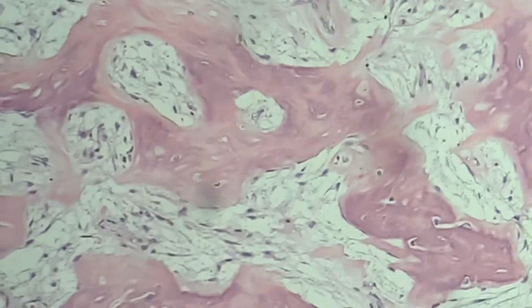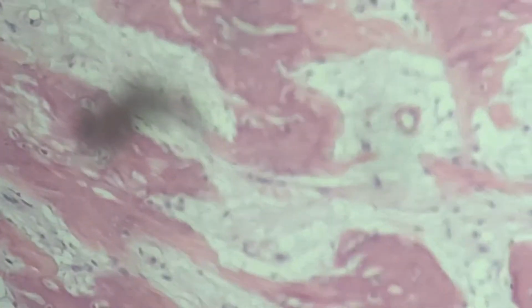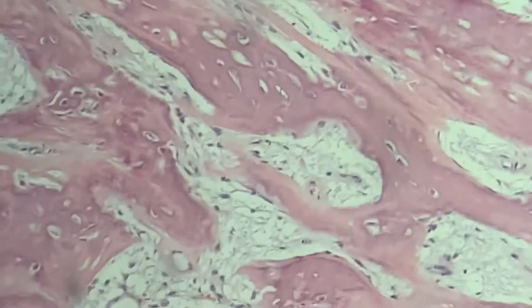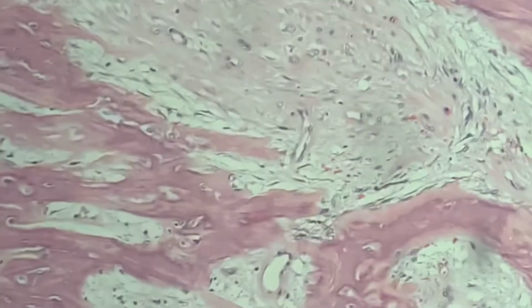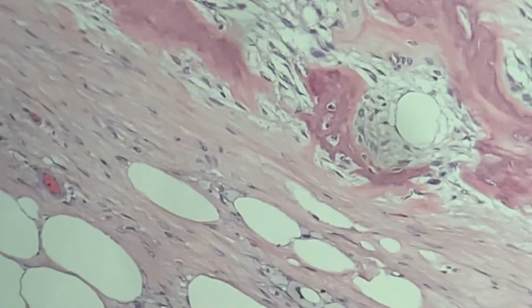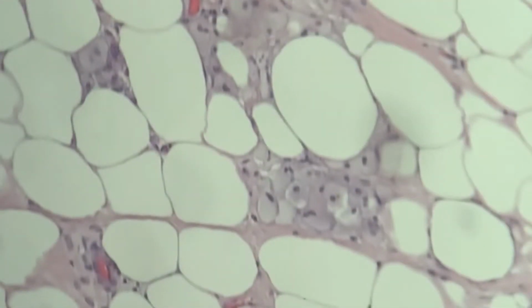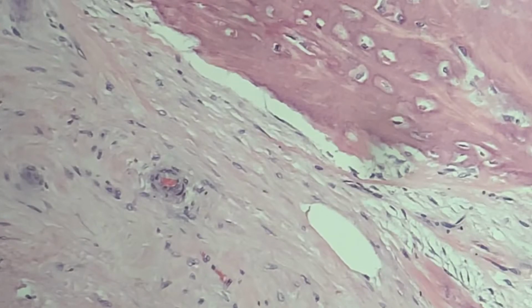Very mature bone with extreme organization, suggesting that this bone development has been there for some months on end, even perhaps years. This is not something that just popped up acutely or in a short period of time. And it's mixed with fibrous tissue, fibrofatty tissue, with obviously fat necrosis, as you see the little foamy cells there. But let me keep going with the video, with the next slide.